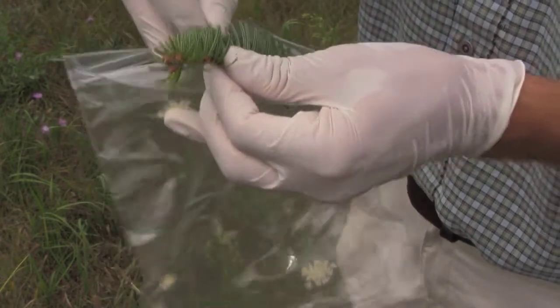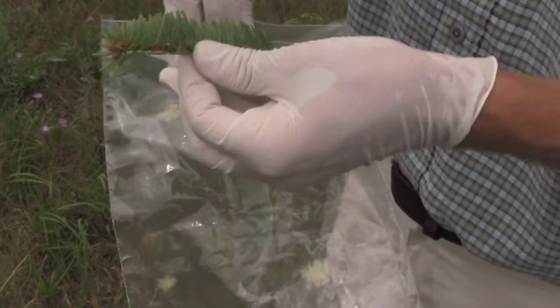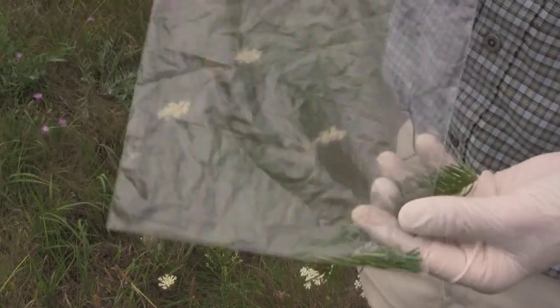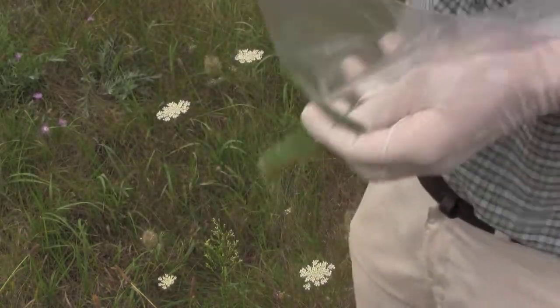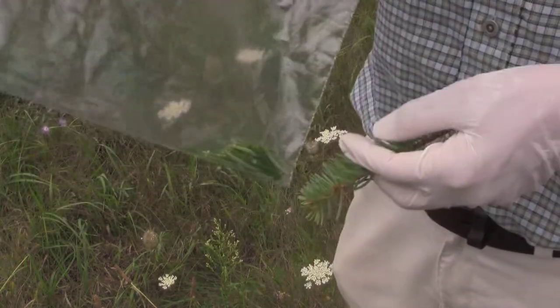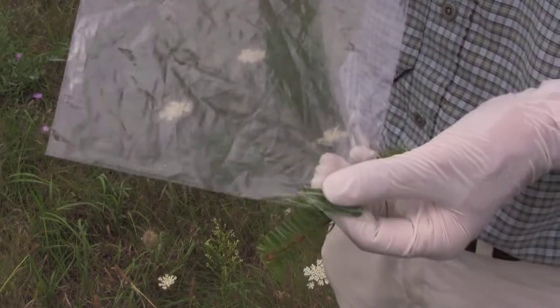The goal is to have a sample representative of the needles on the shoot. Depending on how many trees you're sampling will determine how many needles you collect from each one. You might collect from a bag like this and then go on to collect from another five to ten trees. In the end, you want about two to three ounces of fresh material.